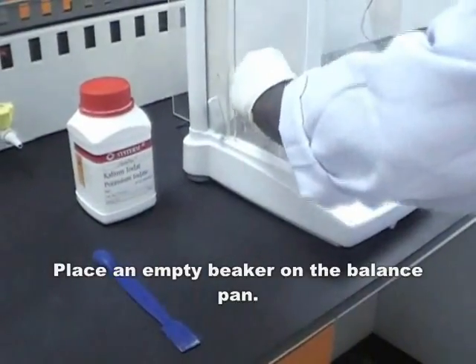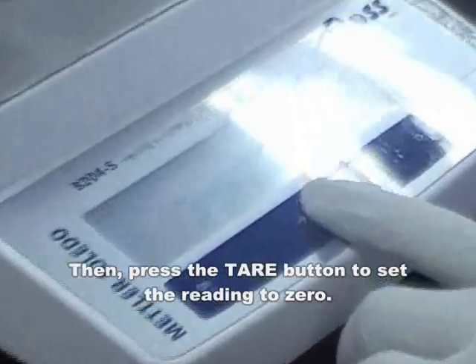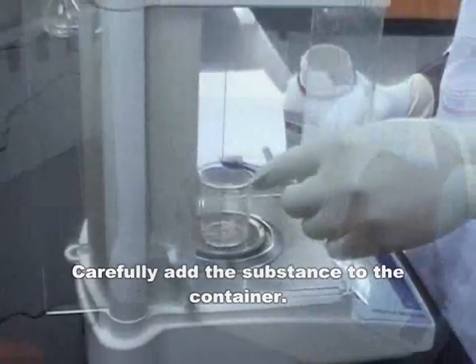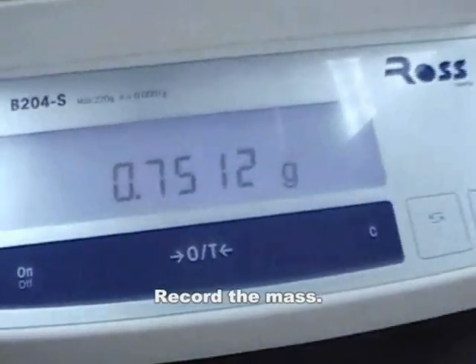Place an empty beaker on the balance pan, then press the tare button to set the reading to 0. Carefully add the substance to the container. Record the mass.